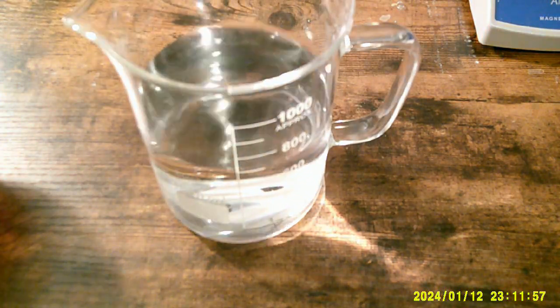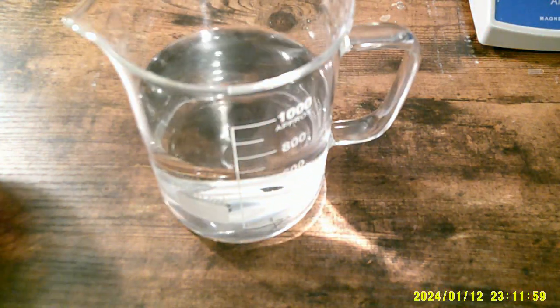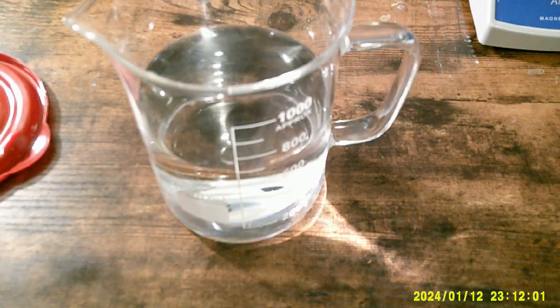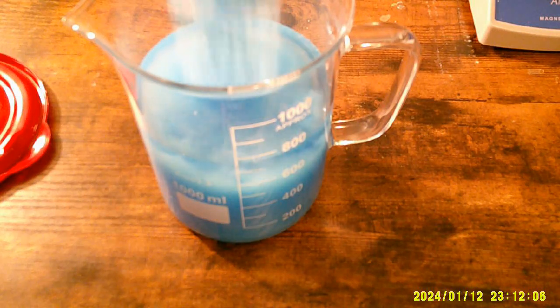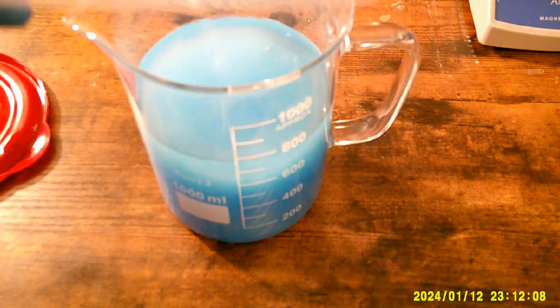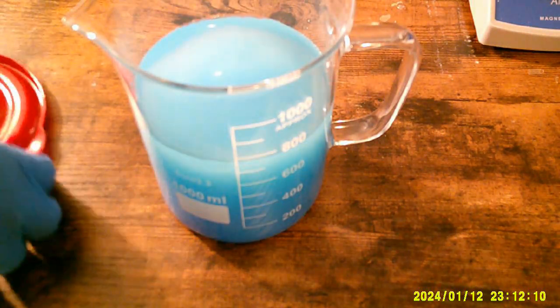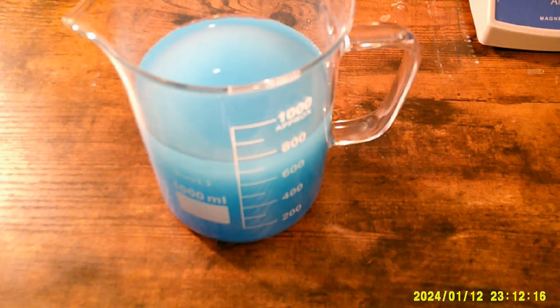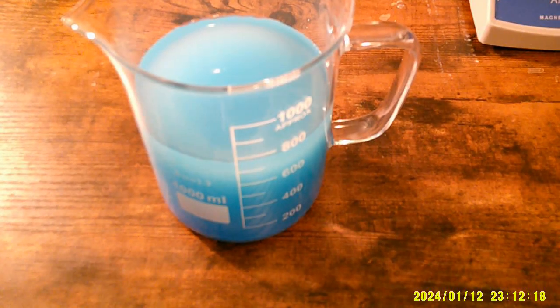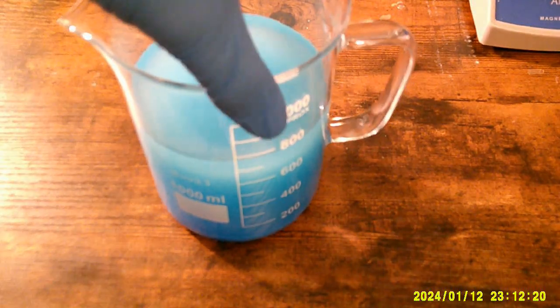Here we go. Here's the water. There's this thing. Now, let me get you a better shot of what I'm going to do next.